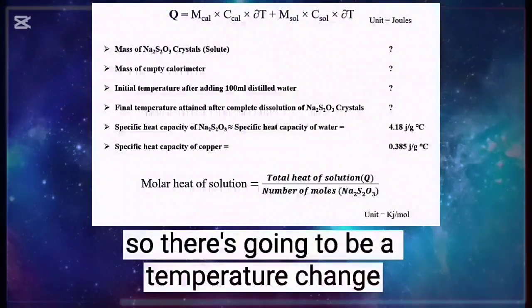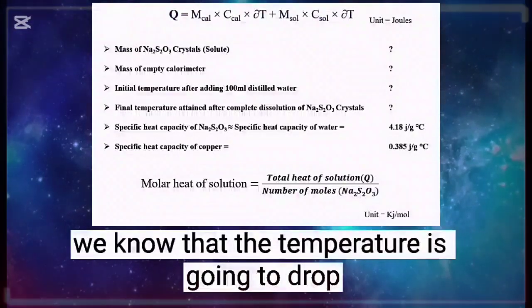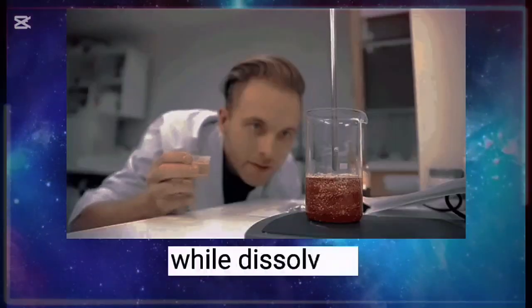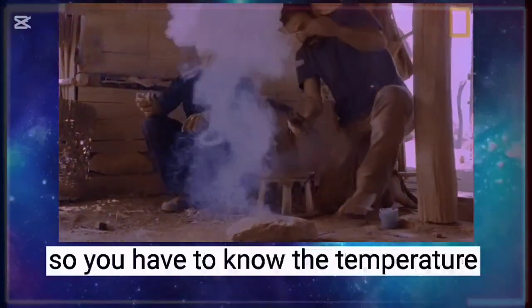So there's going to be a temperature change. In this case, we know that the temperature is going to drop due to absorption of heat by the sodium thiosulphate crystals while dissolving, which is an endothermic process. So you have to know the temperature.